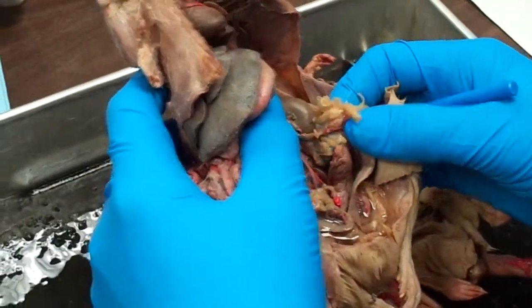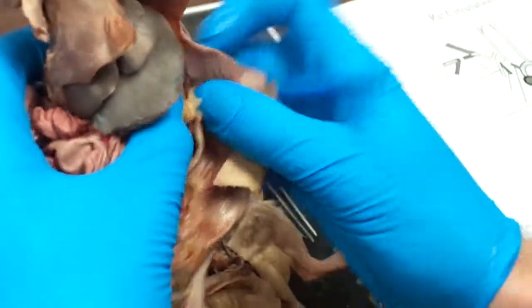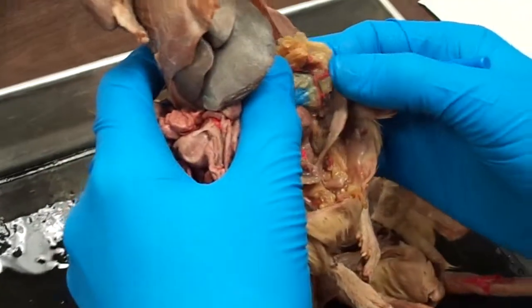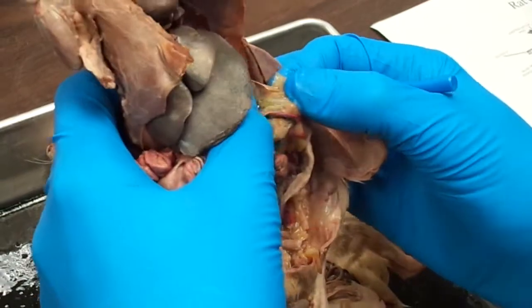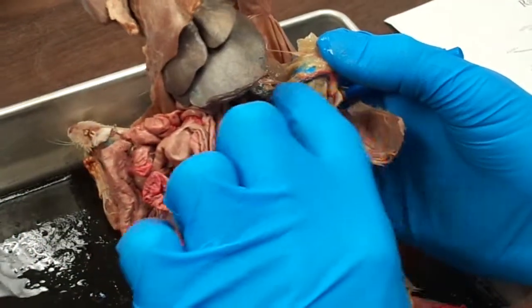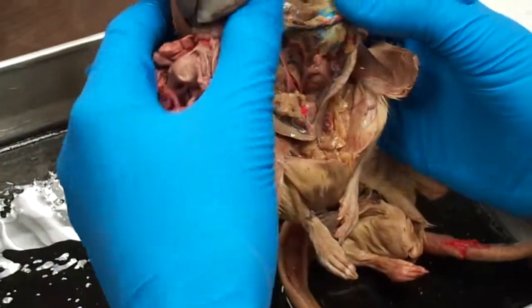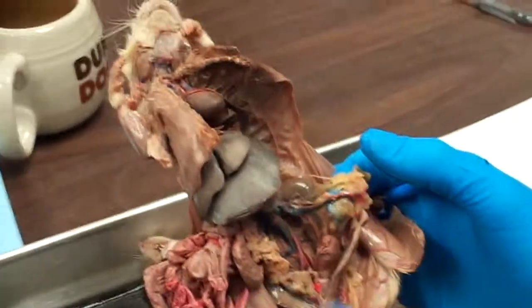So, where's your ovary in the female rat again? Here. In what structure? The oviduct. So, above the oviduct in the ovarian bursae, right? So if you follow your oviduct up, it will be the one running into the ovarian bursae up here. So this guy. Again, right along with the ovarian vein, which does not form the pampiniform plexus. So that's a very good distinguisher of that. It's going to be right next to a giant vein.